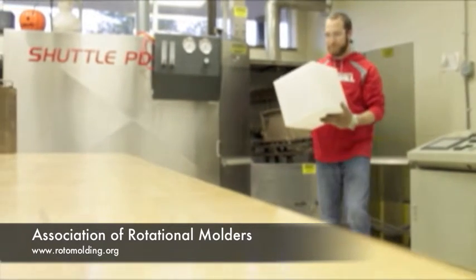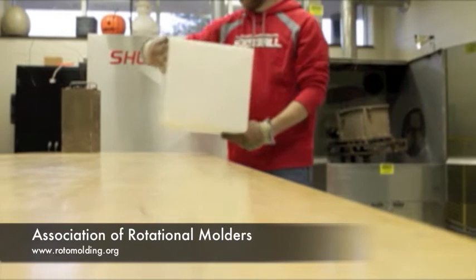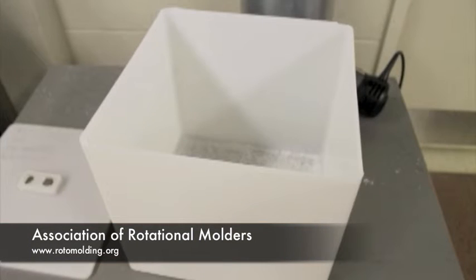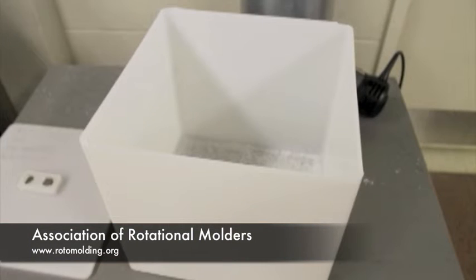Test specimens for impact are from a rotationally molded part. We use the sides of a 12 by 12 cube that was rotationally molded.